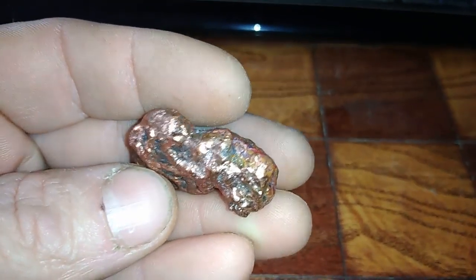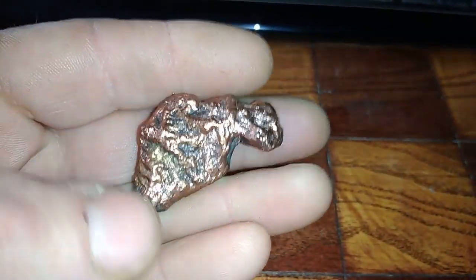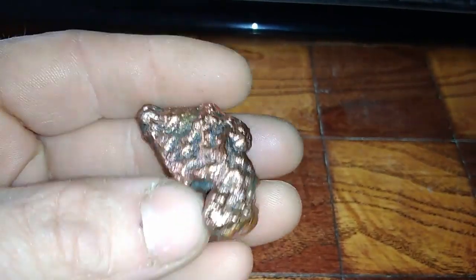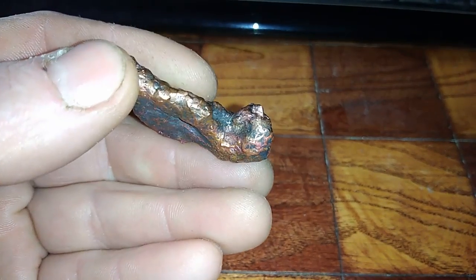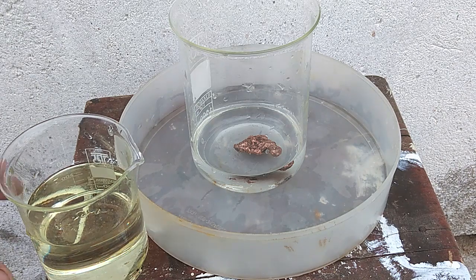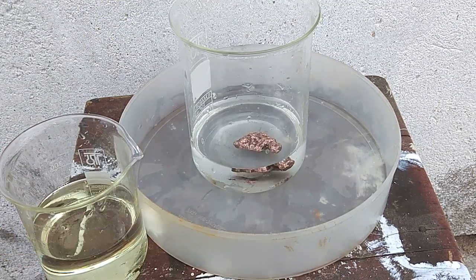If you see, the color is very different. Normally it's copper but you get some other colors on this alloy. I don't worry about the tin in it because at high heat, tin mostly vapors out from this metal. So I think that diluted nitric acid will be the right stuff to process that. Let's start.